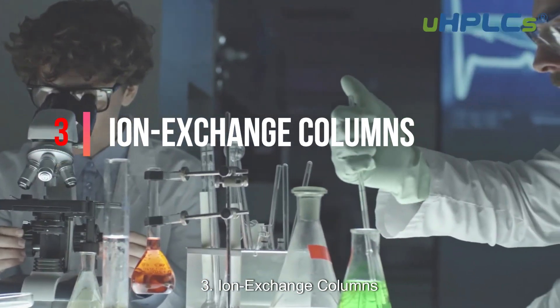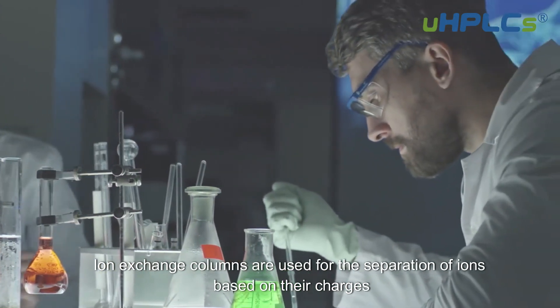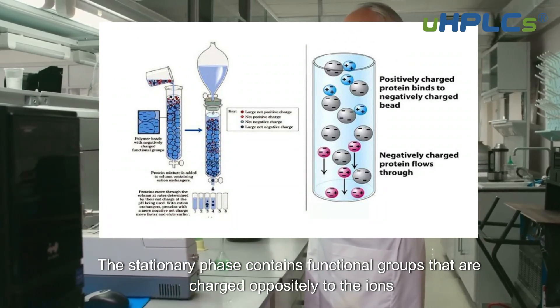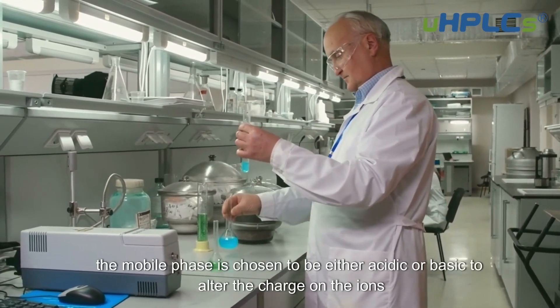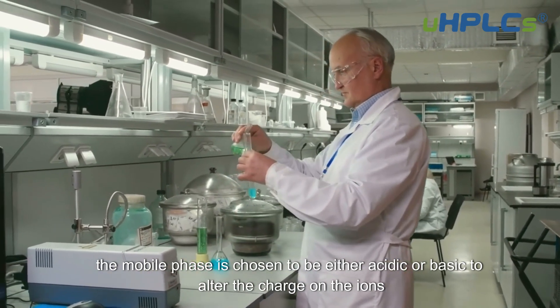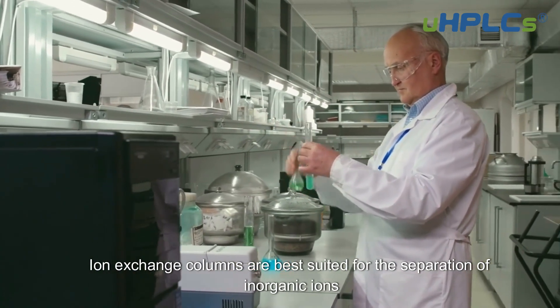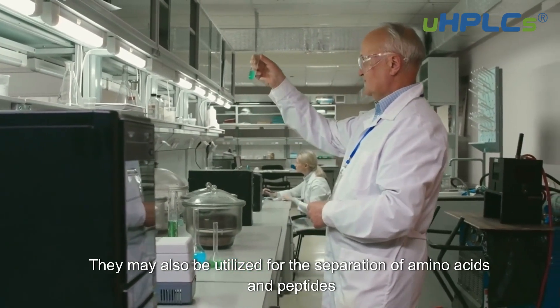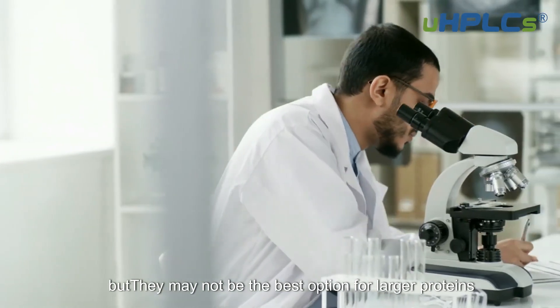Ion Exchange Columns are used for the separation of ions based on their charges. The stationary phase contains functional groups that are charged oppositely to the ions in question. The mobile phase is chosen to be either acidic or basic to alter the charge on the ions. Ion Exchange Columns are best suited for the separation of inorganic ions. They may also be utilized for the separation of amino acids and peptides, but they may not be the best option for larger proteins.